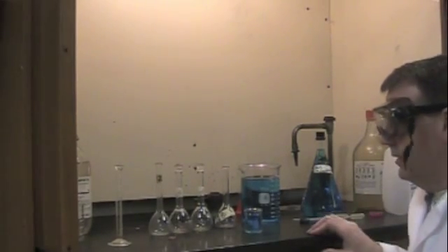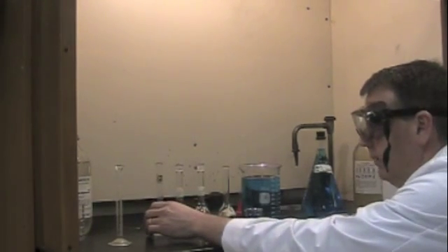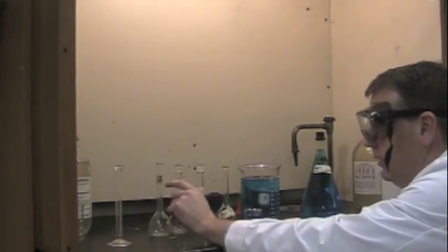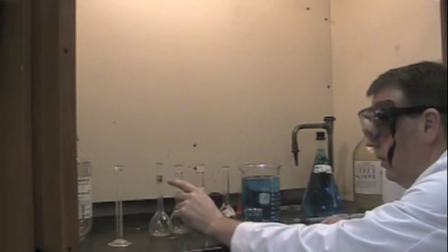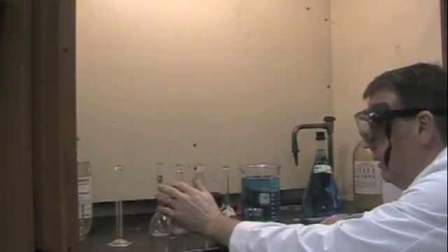What your group needs to do is to get 4 volumetric flasks, 100 milliliter volumetric flasks, and they need to be labeled 2, 4, 6, 8, or 20, 40, 60, 80. It doesn't matter, just so you can keep track of what's in what.